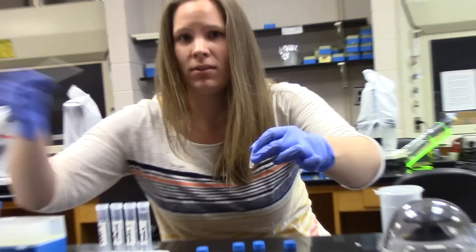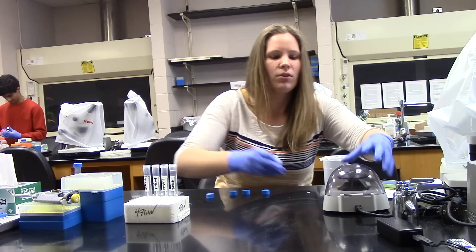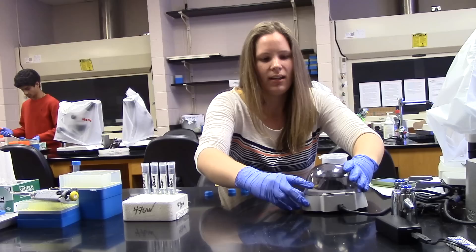Now dispose of this in your biohazard. And all of the pieces we want to collect at the bottom so that we're not plating these. So go ahead and centrifuge for just a second or two with the balance.